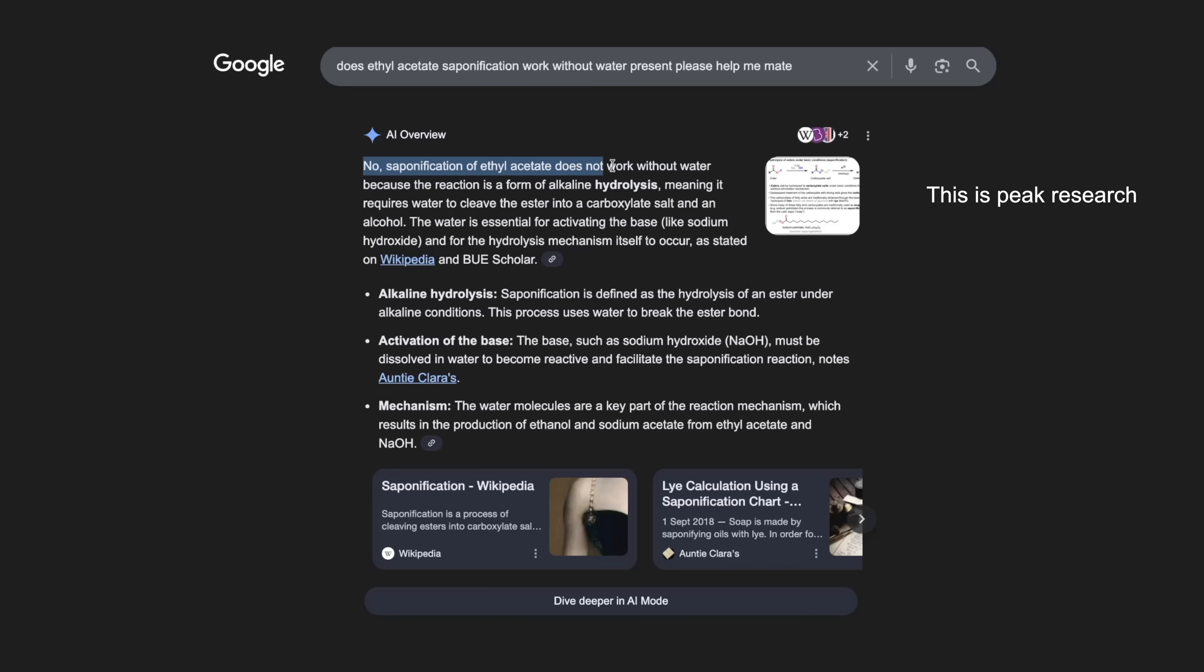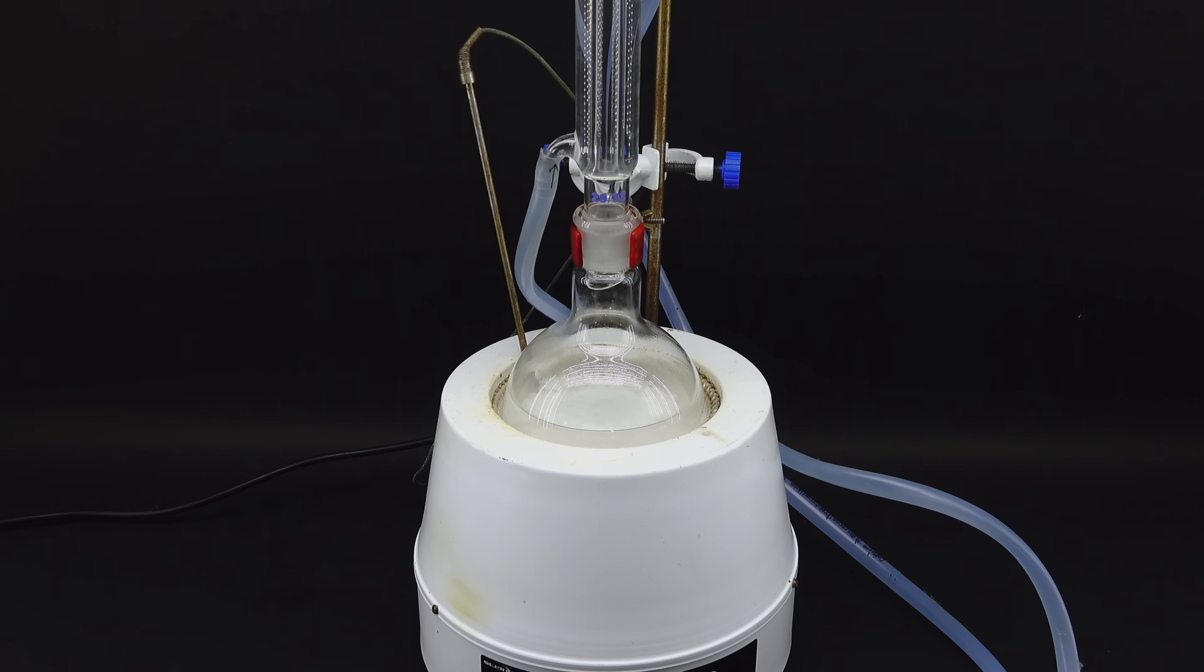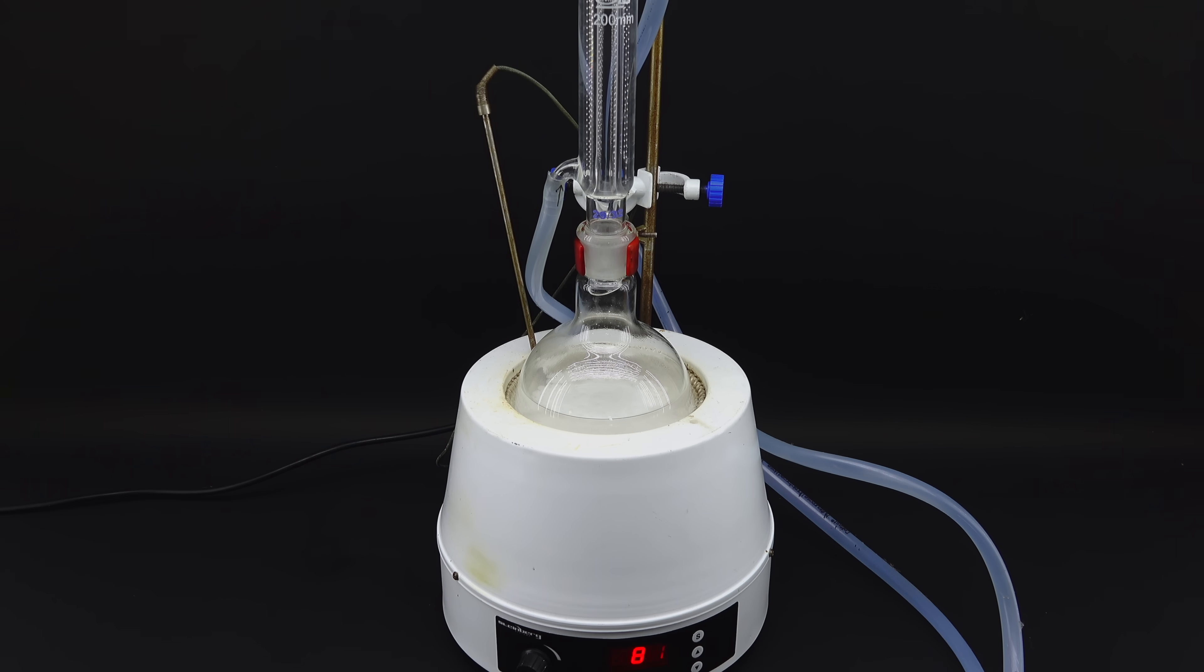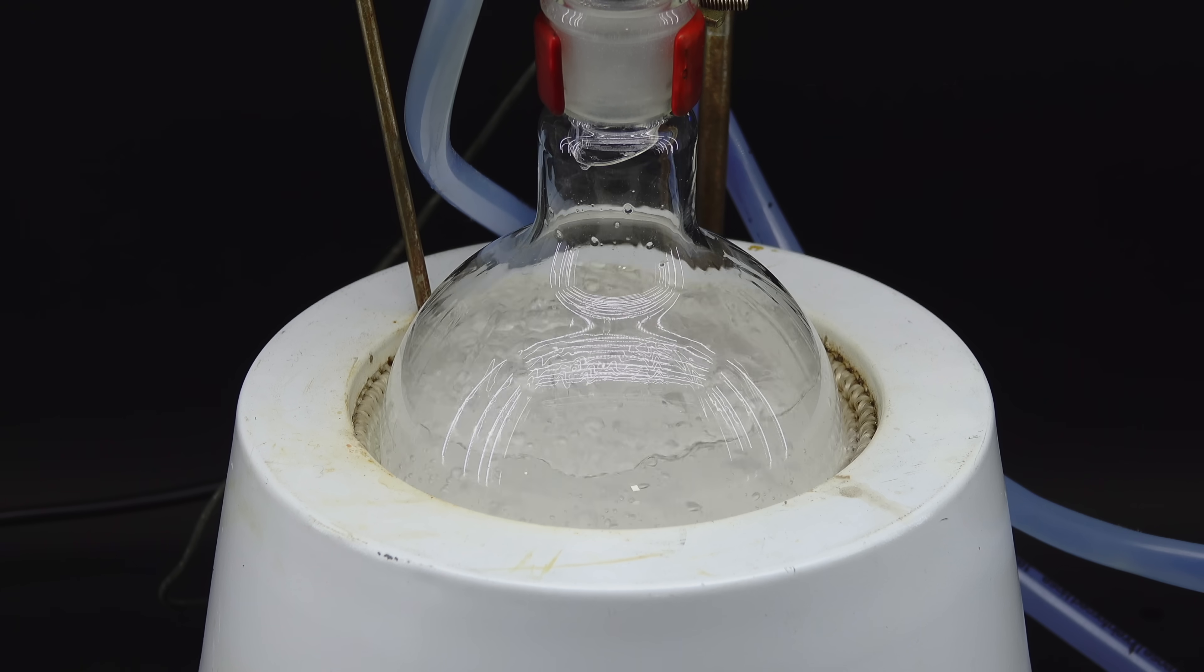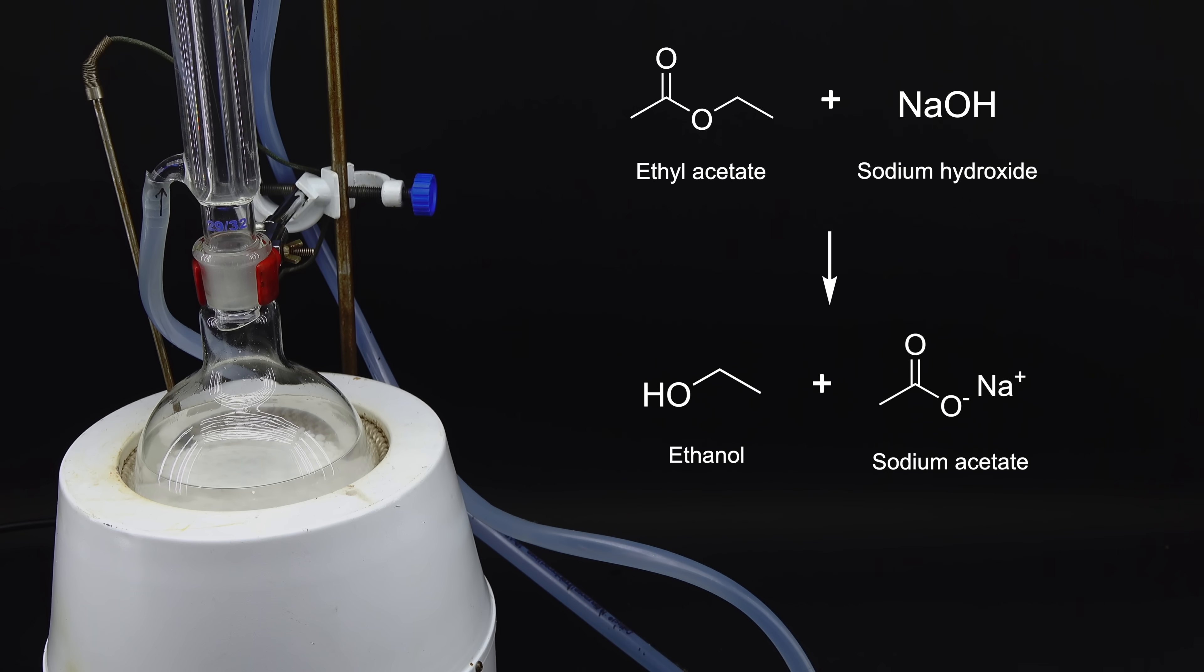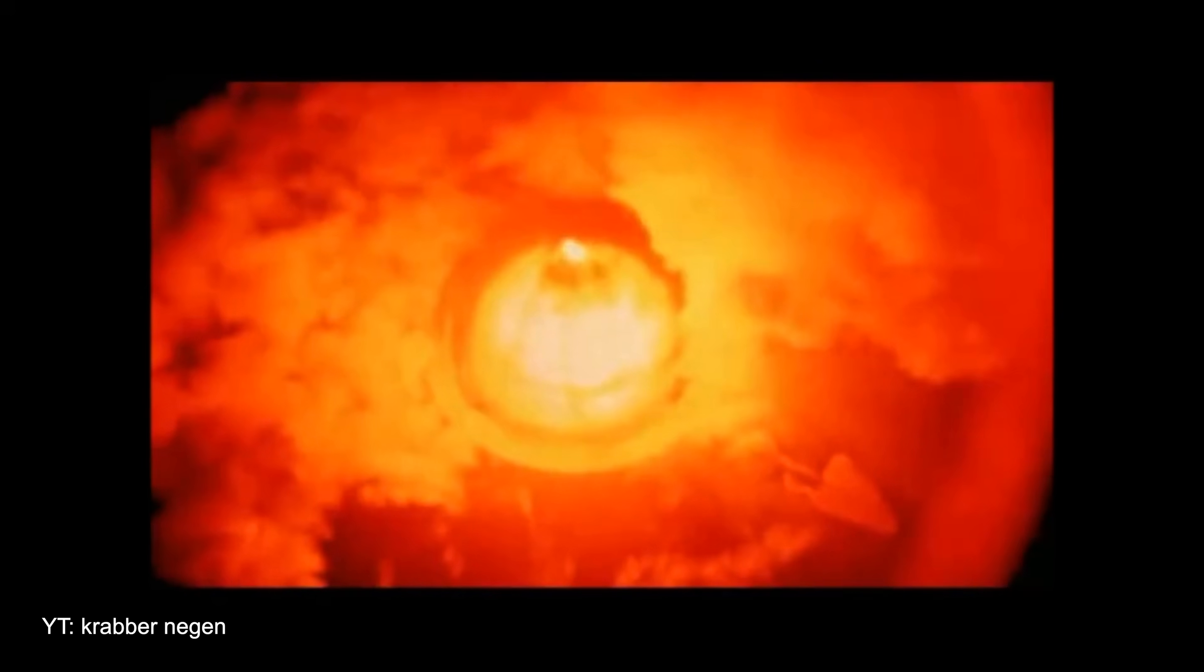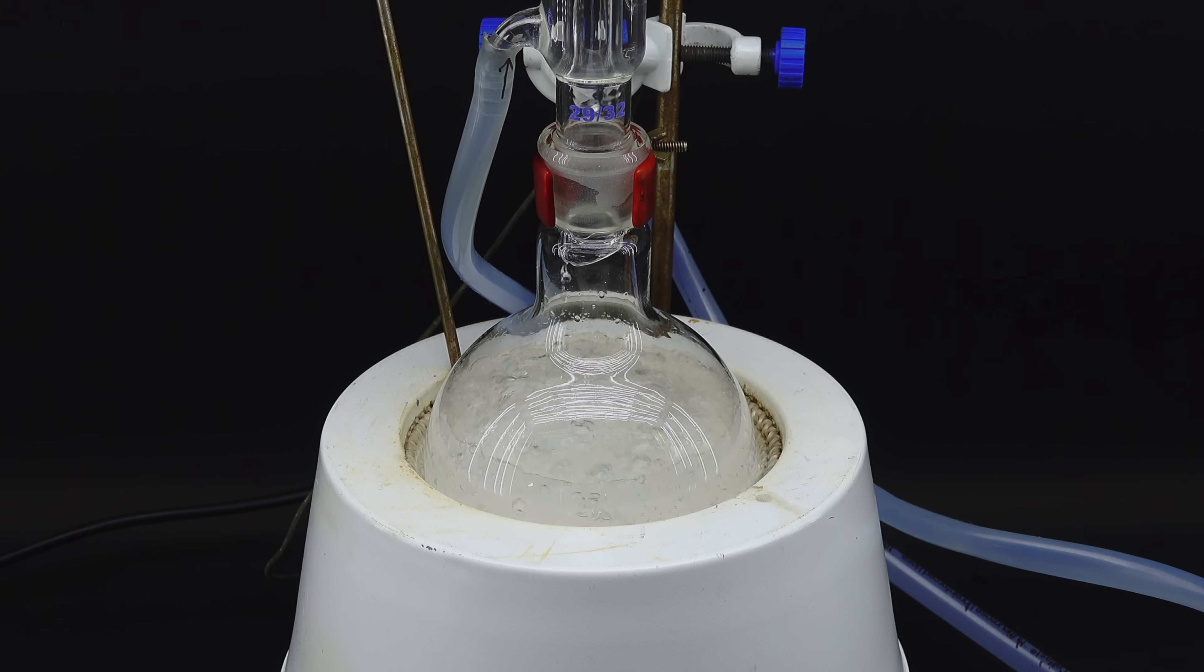I really didn't want to call this project and my supposed chemistry skills a failure. However, just as I was about to admit defeat, something unexpected happened. You see, if this reaction somehow began without any water present, the generated alcohol would be able to dissolve the sodium hydroxide much like water, which, coupled with the enormous amount of heat generated, could lead to a runaway chain reaction. That's the same kind of reaction that makes nuclear bombs work, and what do you know, the reaction mixture nearly exploded.